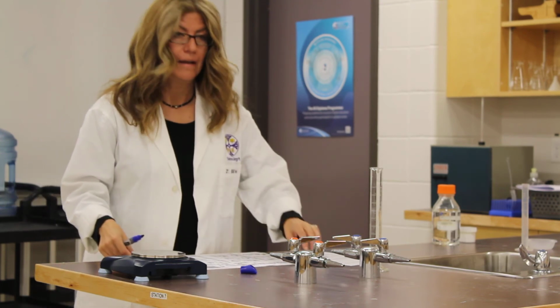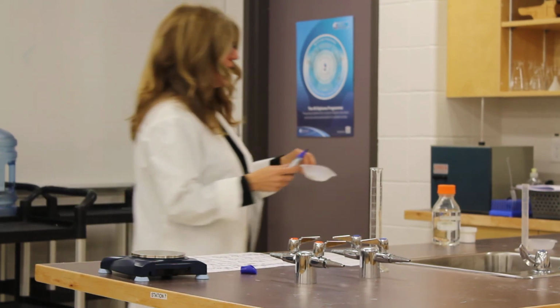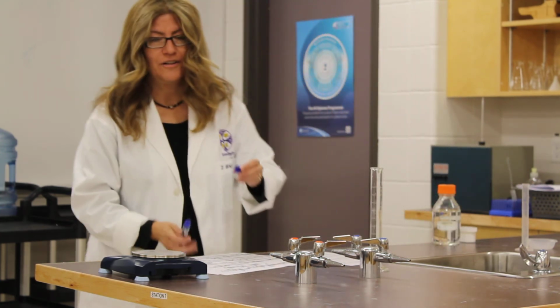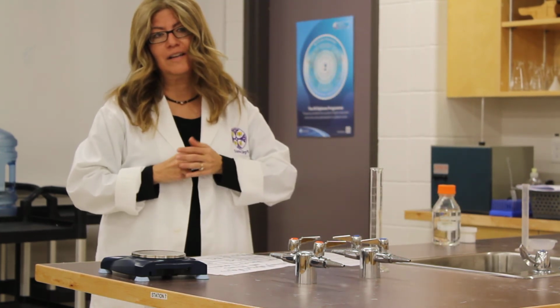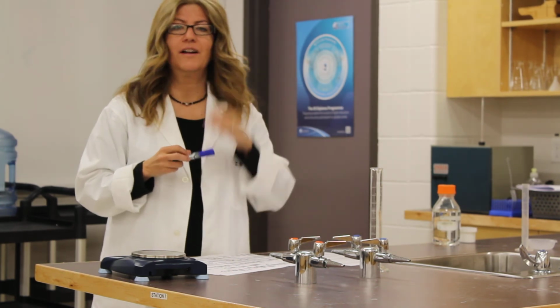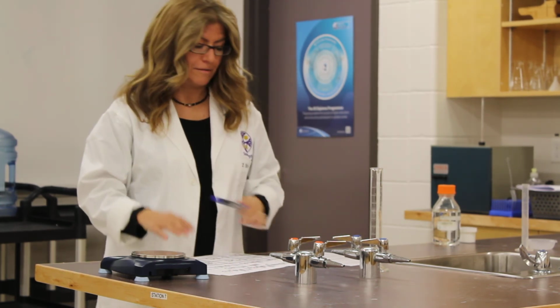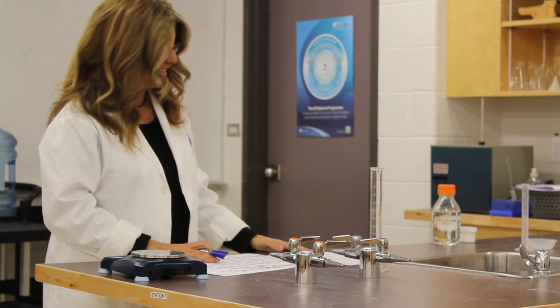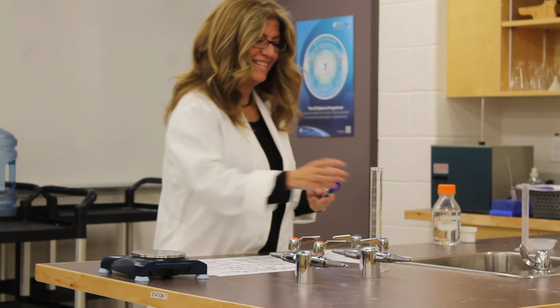Should it smell? Yeah, I think so, because it's reacting. You're smelling the hydrogen gas. I'm smelling something. If we collected the hydrogen gas, we could do the test for hydrogen gas and make a really cool popping sound. But we're not going to do that, because it's explosive and dangerous. Danger. Especially with us.